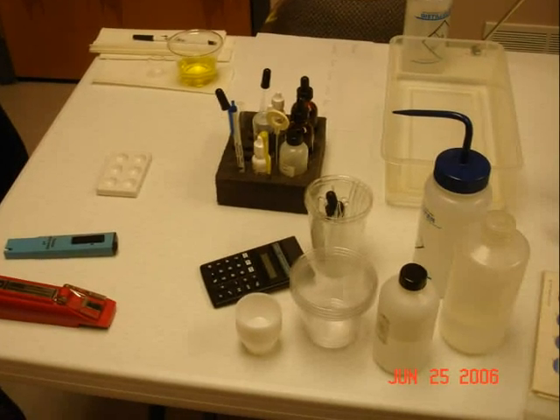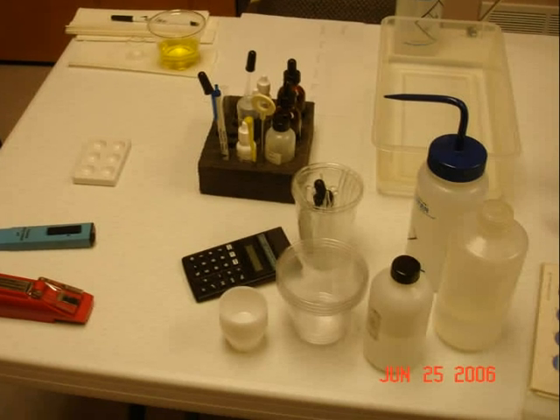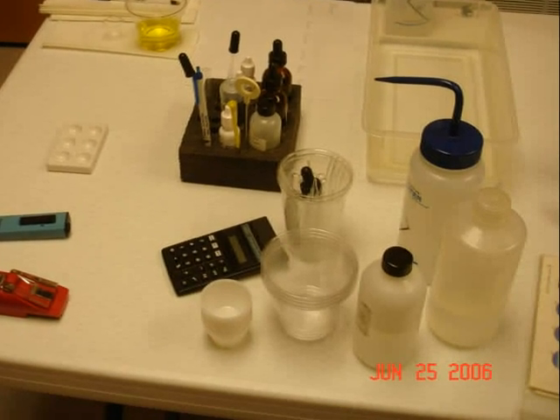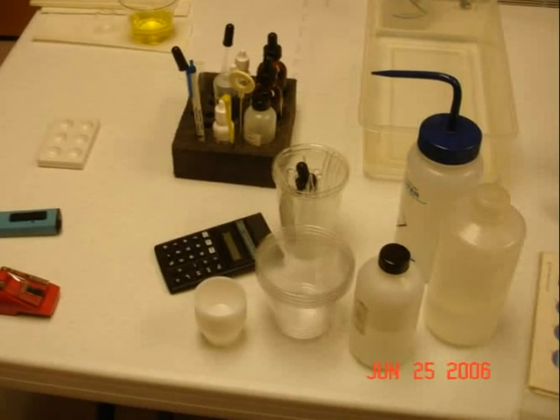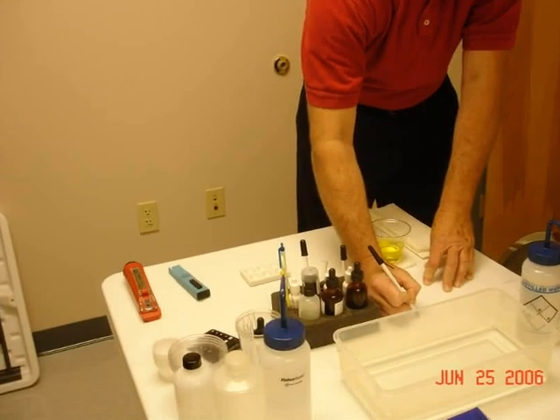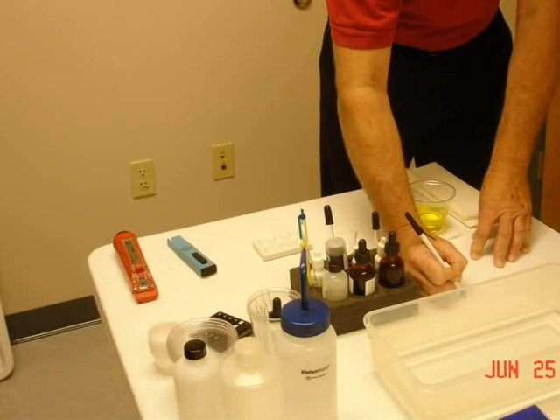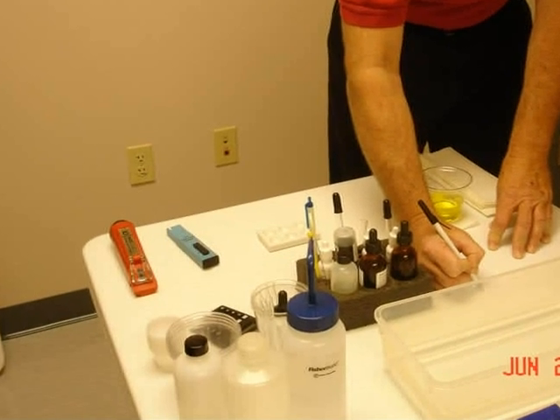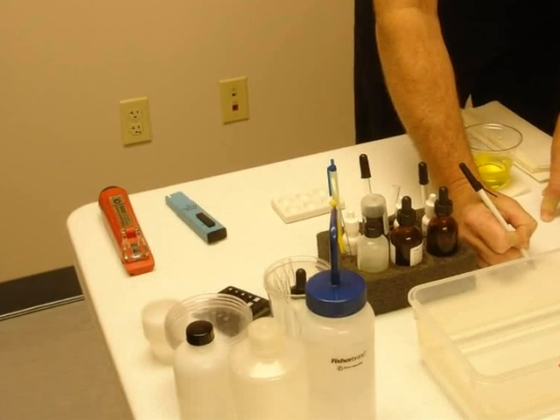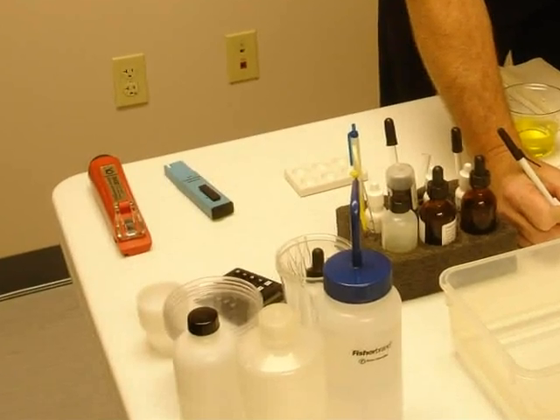You must have your equipment cleaned and laid out properly and in good order so that you can go through your steps one, two, three, four, right down the line. Before you even start running the analysis, you have to fill out your card so that you have all the details on your client and so that you can keep track of what you're doing.